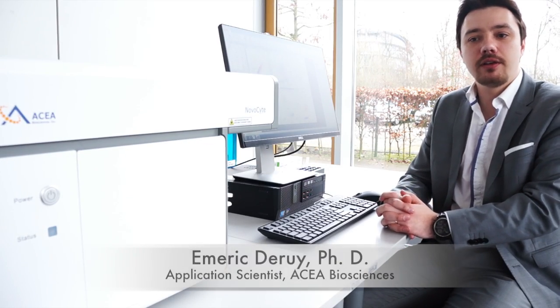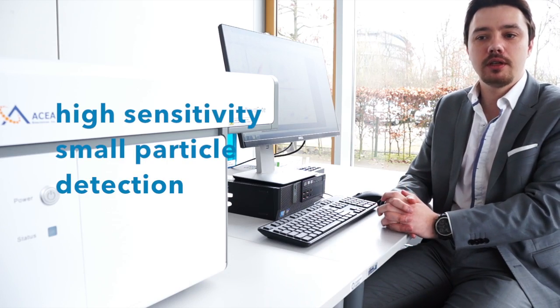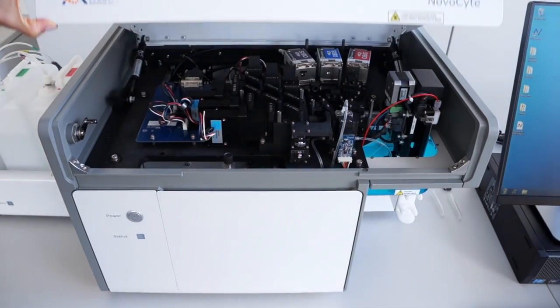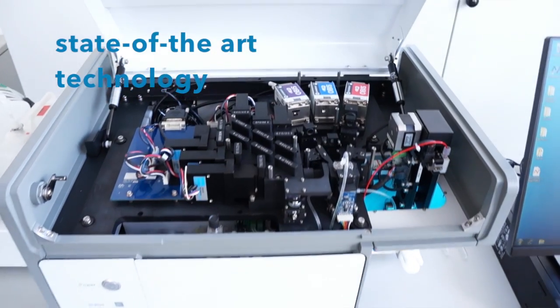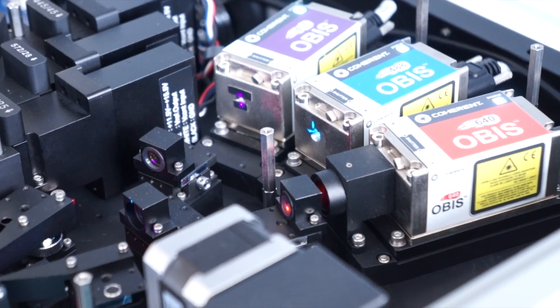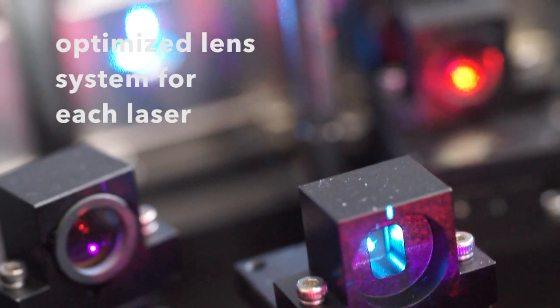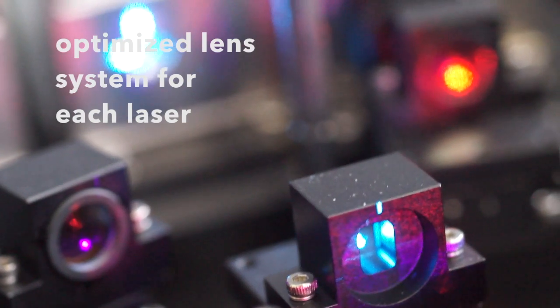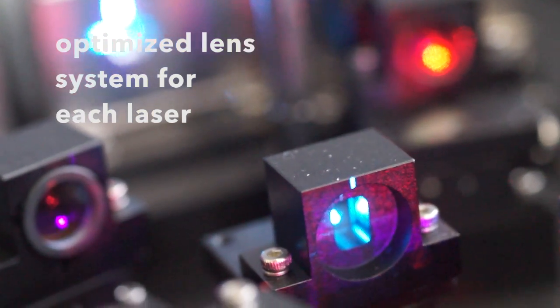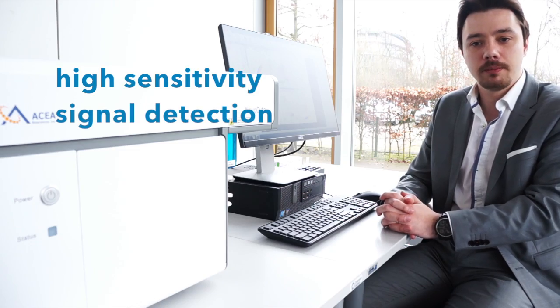The innovative Obscuration Bar is designed to give higher sensitivity for small particle detection. Each laser beam targeting the flow cell individually with an optimized lens system, giving high sensitivity for your signal detection.